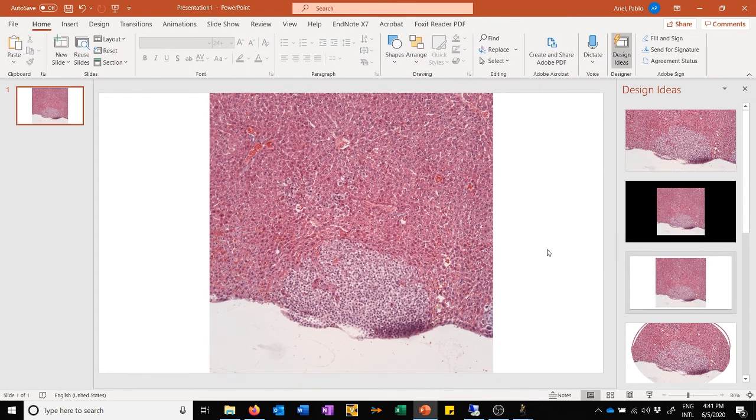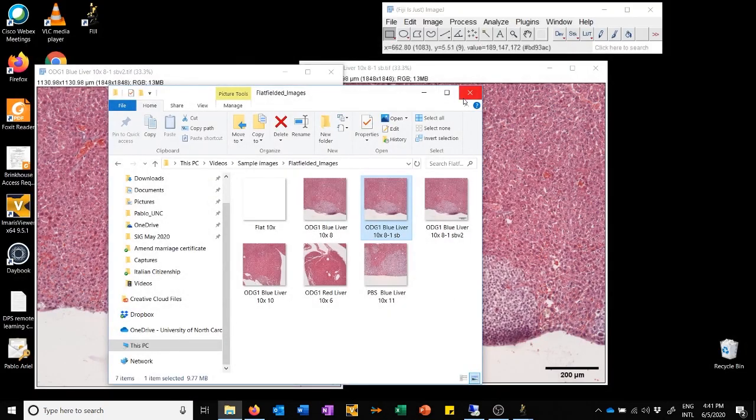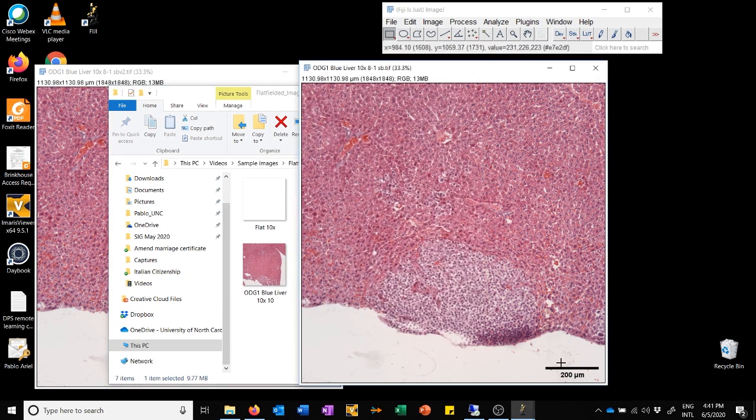I haven't actually been able to piece together why that occurs sometimes. But if it does, you now know the solution to this. You can just open the image in Fiji and then flatten it, and then that will burn the scale bar into the image.